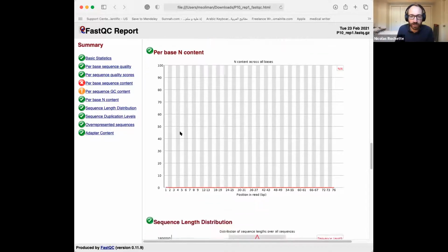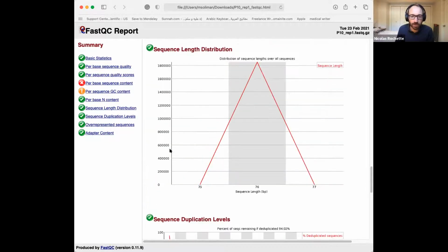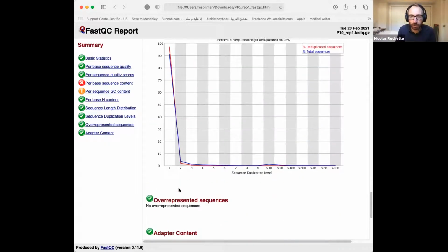Sequence length distribution, the next one: all the sequences are 76, so that's also normal when it just comes out of the sequencer. When we clean the reads afterwards in the next exercise, that is going to introduce differences in sequence length. But generally, you ask the sequencing core for 75, 76 bases of sequencing, and that's what the core did. So that should correspond to just what you asked the core.